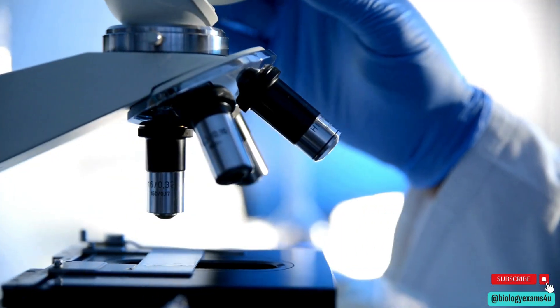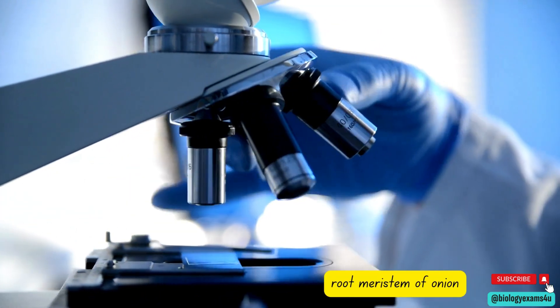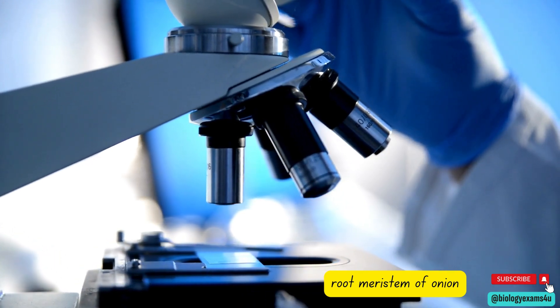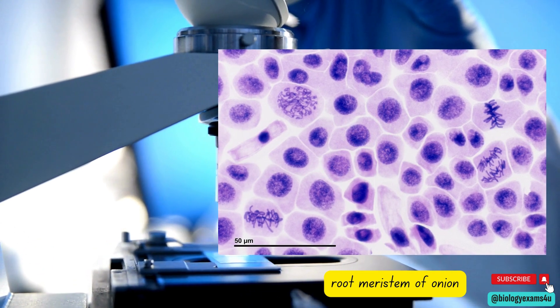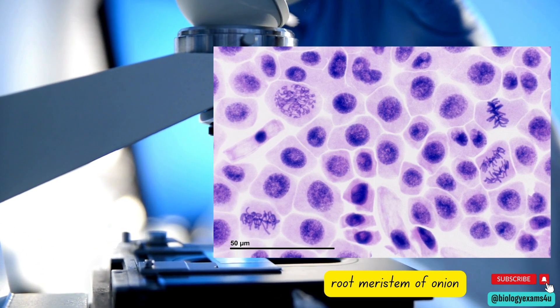So we have onion root tip under the microscope. This is a microscopic view and we can see the cells.